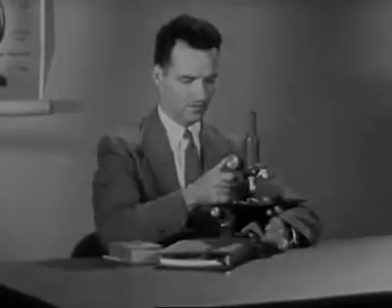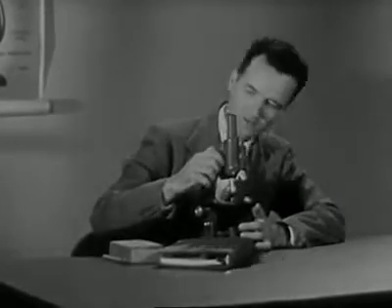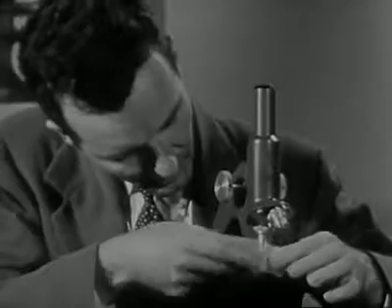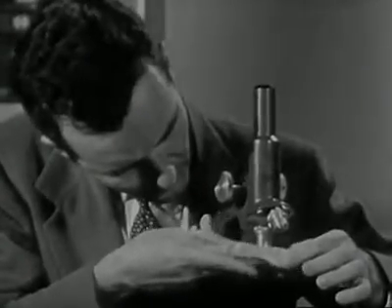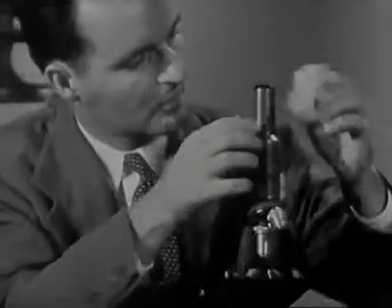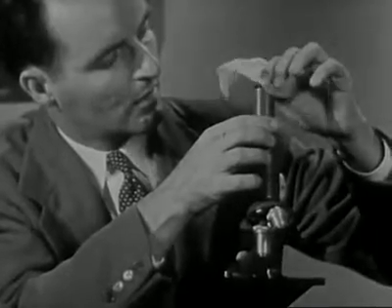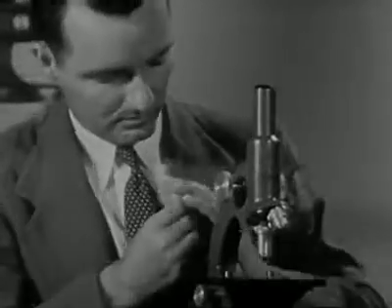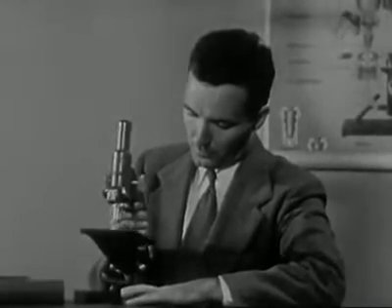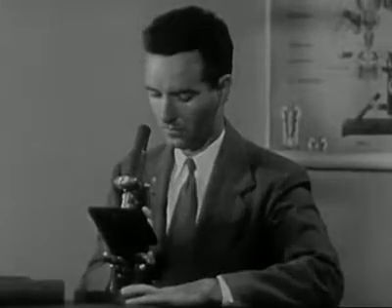In using the microscope, the first step of preparation is in making certain that all lens surfaces are clean and free of dust and lint. If the instrument hasn't been used for a time, the lenses will probably need cleaning. Use lens tissue, never your handkerchief, and gently clean the objectives and the eyepiece. The glass from which the lenses are made is soft and easily scratched, so be very careful. Then, unless you are instructed otherwise, tilt the microscope body until it is in a comfortable position for you to use.